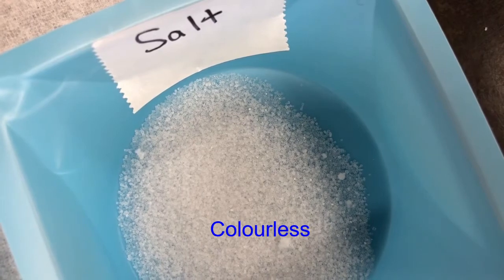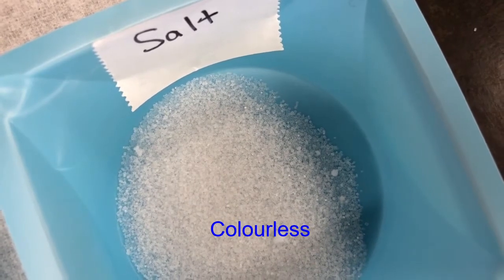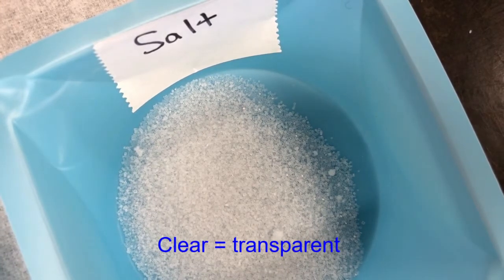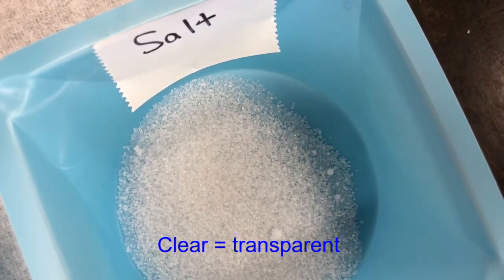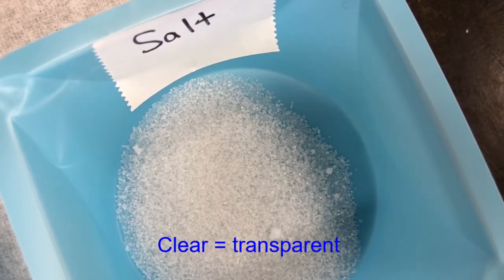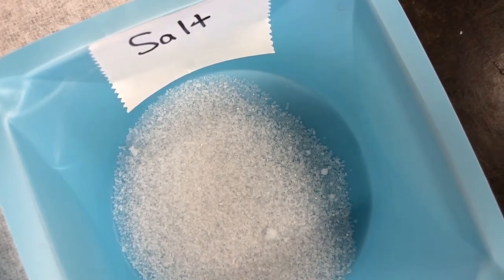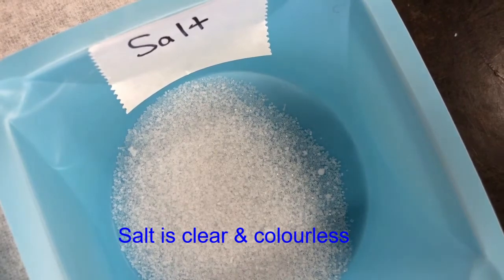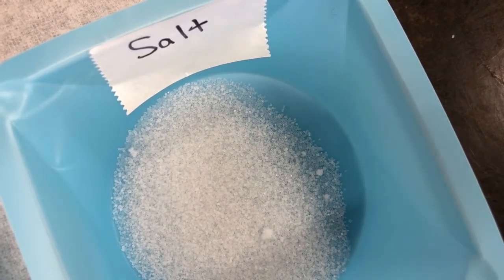It's also important to make the difference here between clear and colorless. Just because something is clear does not necessarily mean it's colorless. When we think of clear, it means you can see through it. If you think of something like filtered apple juice, it's clear in that you can see through it, but it still has a color. So it will be clear, but not colorless. When we look at these crystals here now, we can see that salt is clear and colorless. So it's a colorless substance. It's not white, even though as a group it looks white. When we're describing the color, we're going to look at an individual crystal. So salt is colorless. Let's move on to our next substance.